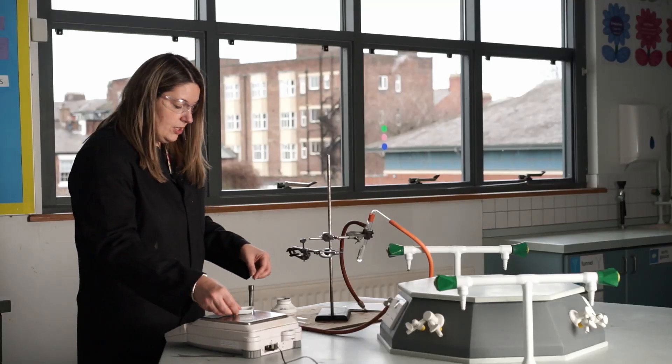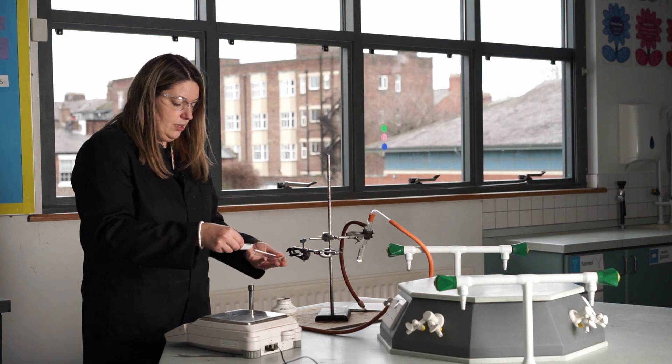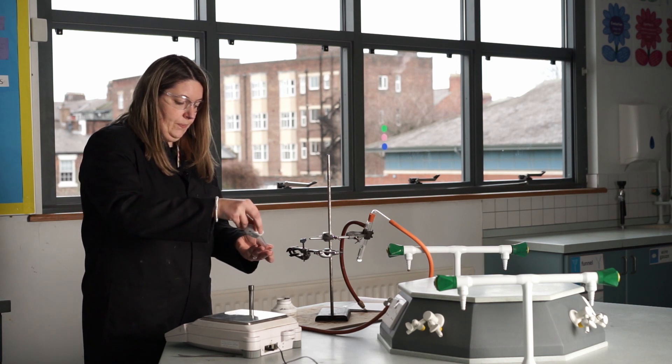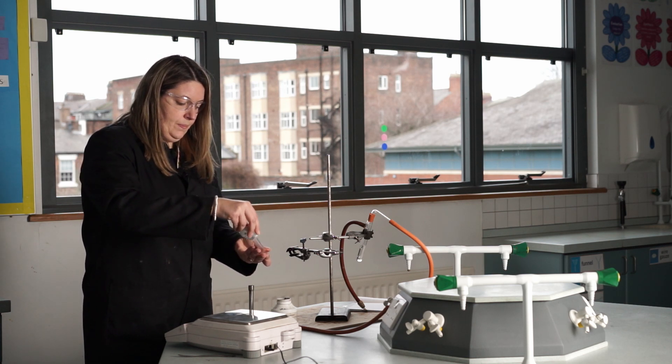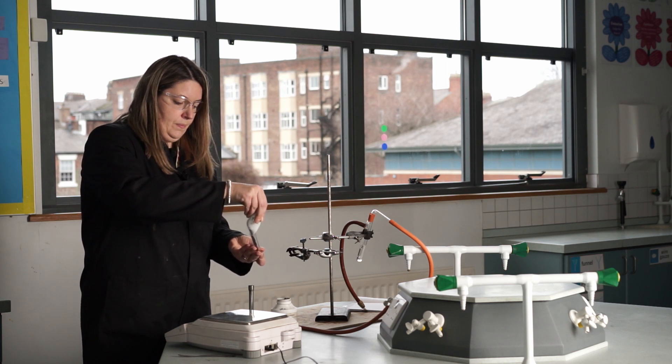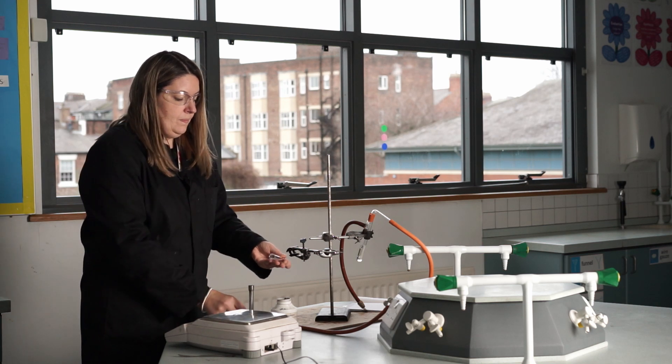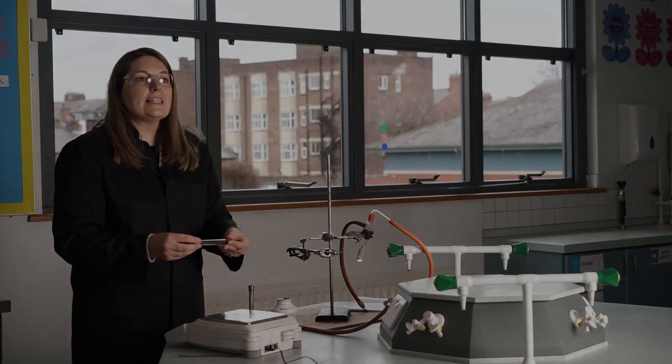Then add that to my tube, being careful not to let it escape out of the end. And my mat's ready to then set up.